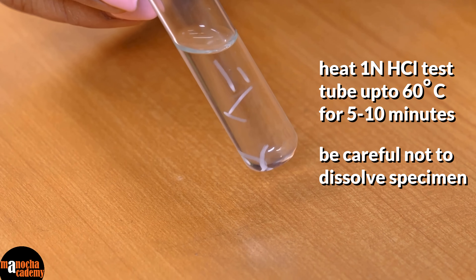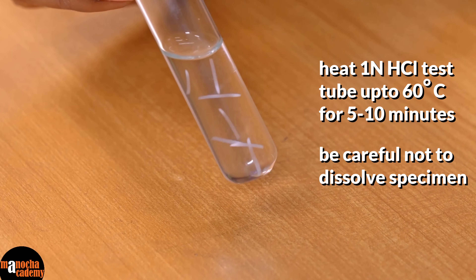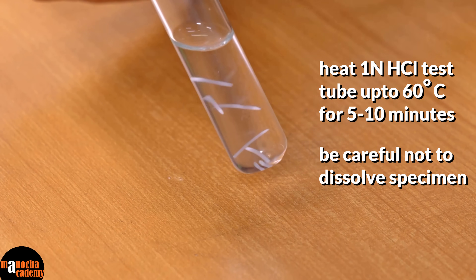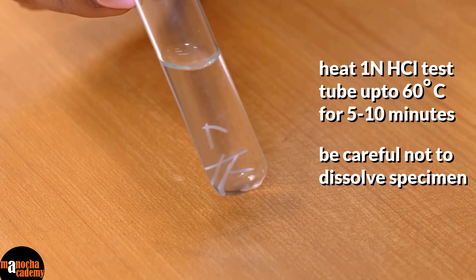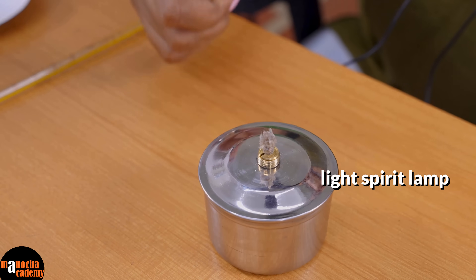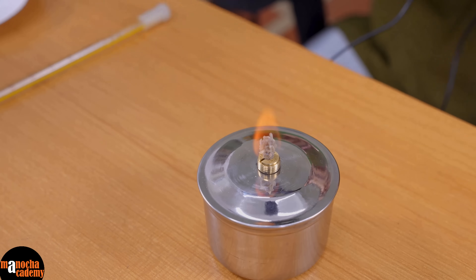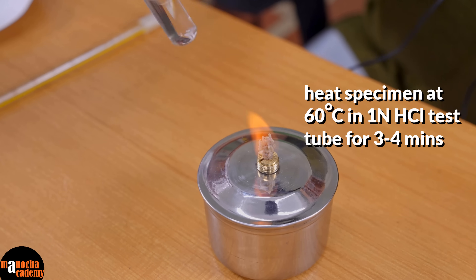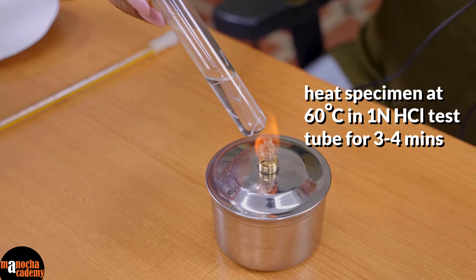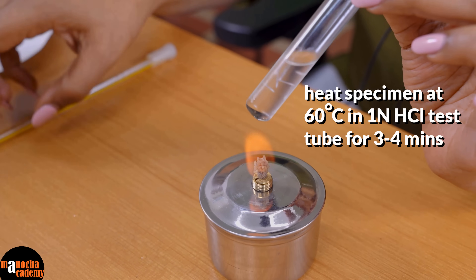But usually the process requires you to heat it for 5 to 10 minutes. I have usually seen that if you heat it for about 5 minutes at 60 or just below 60 degrees it is fine. Now we will use this spirit lamp and light it, and we will be heating these specimens in hydrochloric acid for about 3 to 4 minutes, making sure that the temperature is 60 degrees and not more than that.